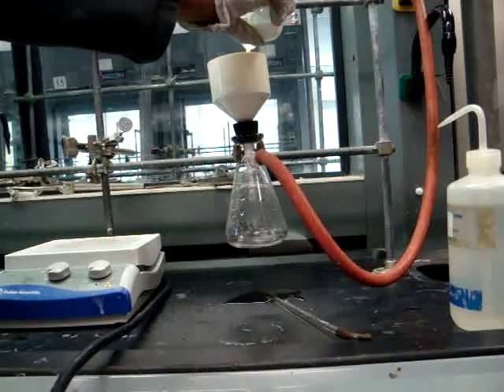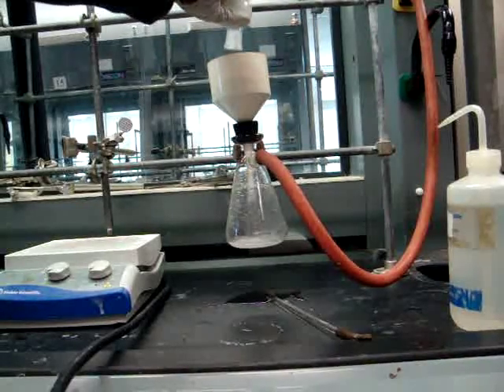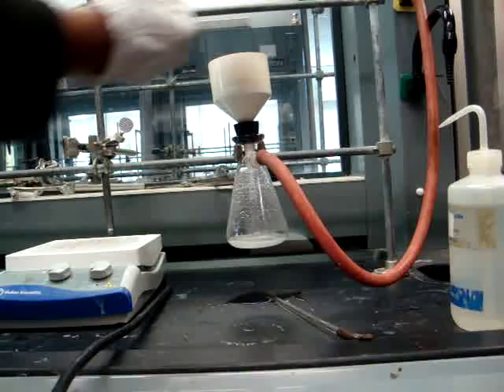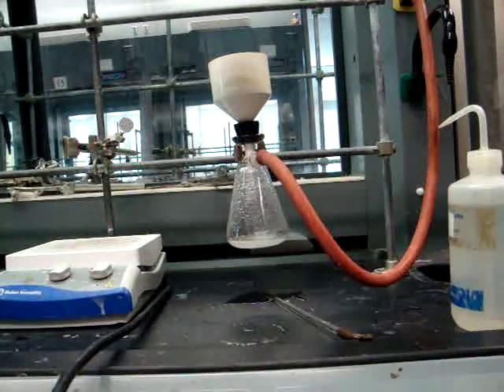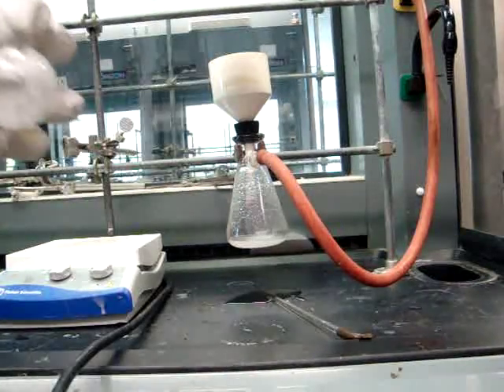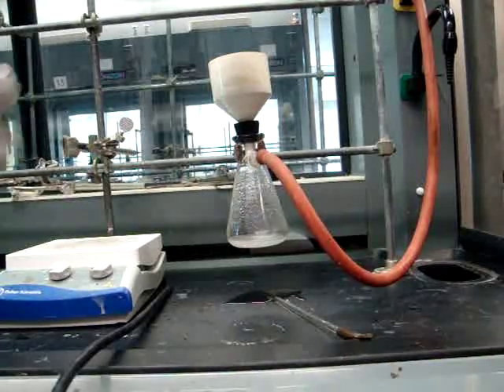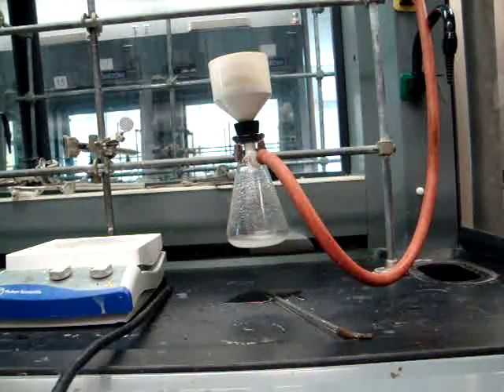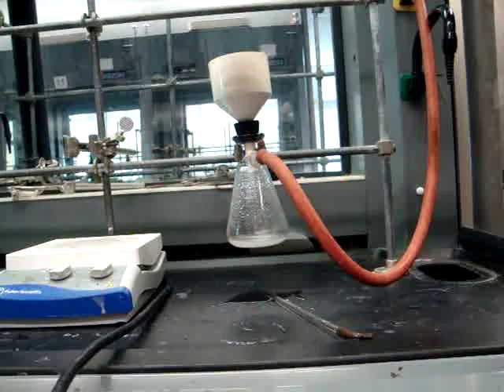As we said before, you will then be filtering out your solid with a Buckner funnel. Make sure that you get complete transfer and rinse the inside of the round bottom flask with water.